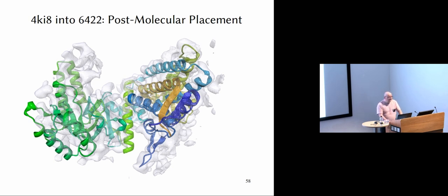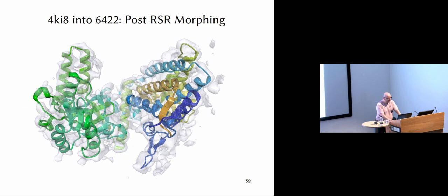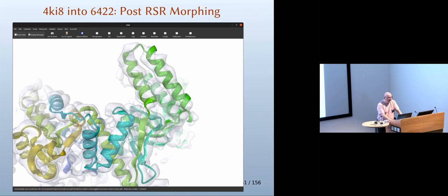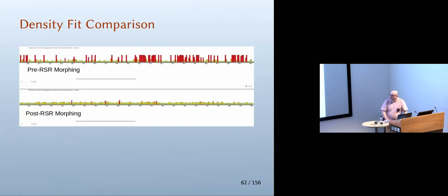This is also a Coot screenshot. Okay, so this is post-molecular replacement, but pre-fitting. And so that is the fitting algorithm results there. Then this sort of operation takes about 30 seconds. Let's look at that from the other side of view. From the other side, you can see those pair of helices on the right there don't fit very well, but when we use Geman-McClure restraints in the real space refinement in Coot, you can see that whole domain tipping and going into where we hoped it would go. Okay, so the line above is the density scores before and after fitting. You can see it's a rather better fit.